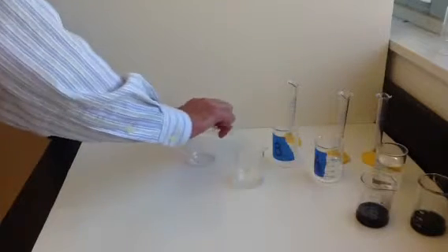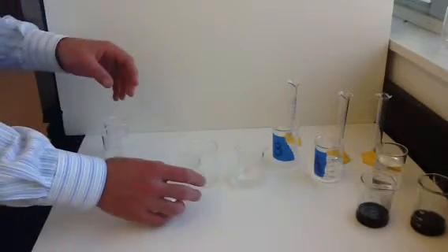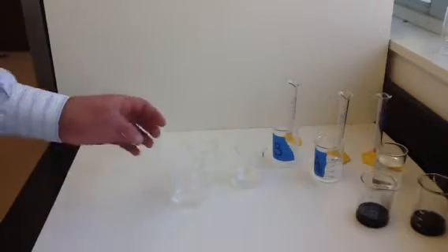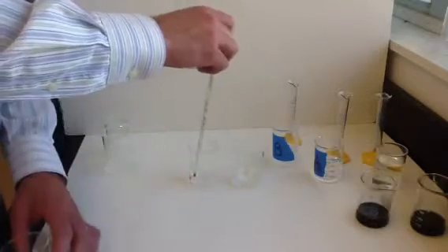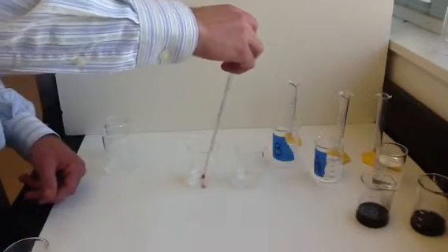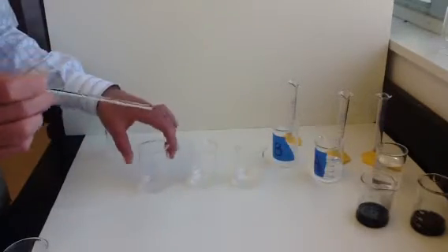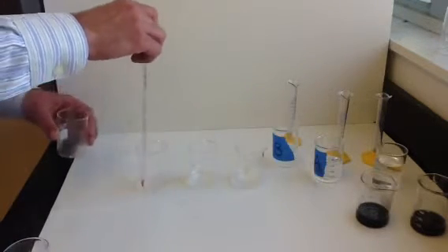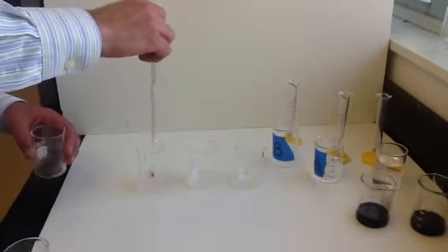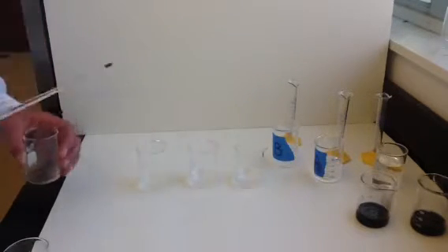In our fourth and fifth trials, we're going to be varying the temperature. So I have this beaker of A and B that were on a hot plate, and these two have been warmed. And so I'll pour these two together. We'll measure how long these take to react. This one is about 40 degrees Celsius. And then this one has been on ice. This one is our cold one. And this one was starting at about 7 degrees Celsius, and we'll see how long that one takes as well.